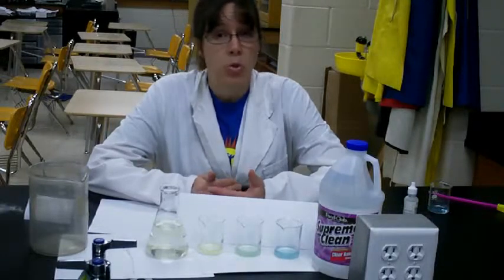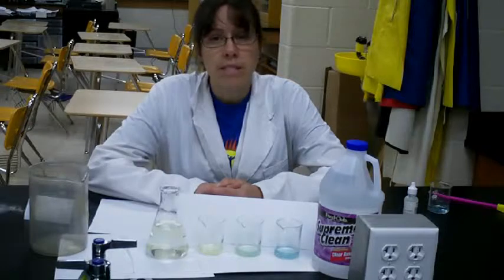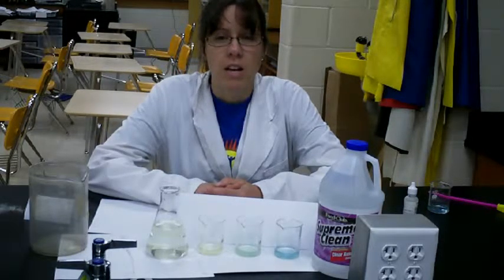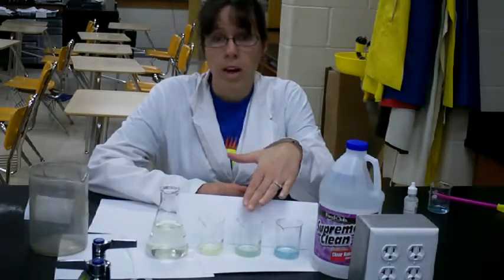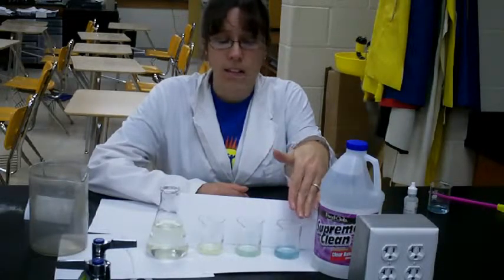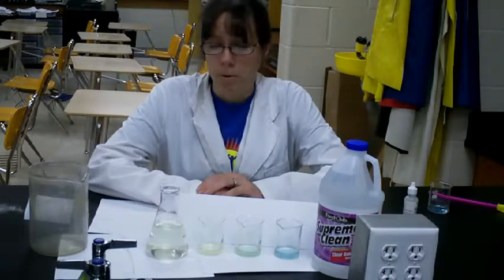And since we have a pure carbon dioxide sample, we're going to be able to figure out what is the percentage of carbon dioxide in each one of the samples from this experiment. So to show you what I'm talking about, I just set up our pure carbon dioxide sample, one with the dilution with the indicator from my breath, and then our control, which just has the bromothymol blue in water.